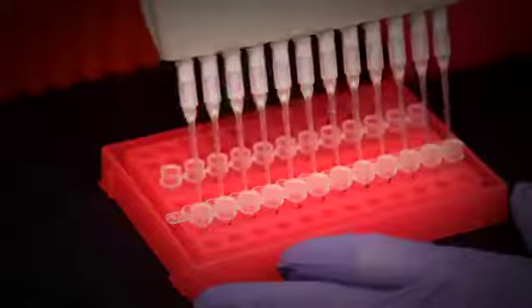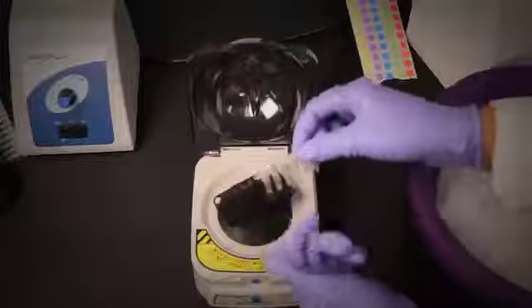Tap the tubes gently to mix the hybridization buffer and reporter probes with the sample that you've just added.